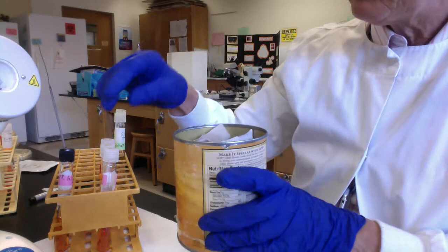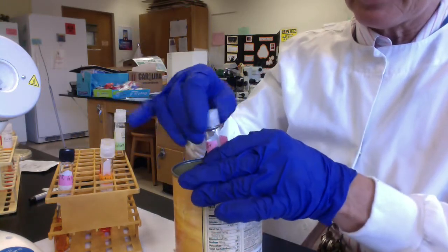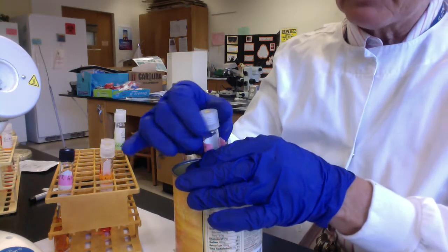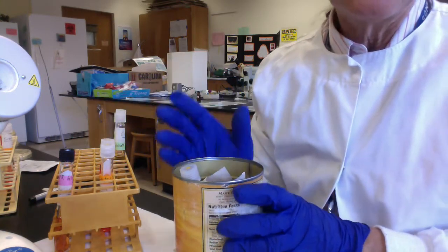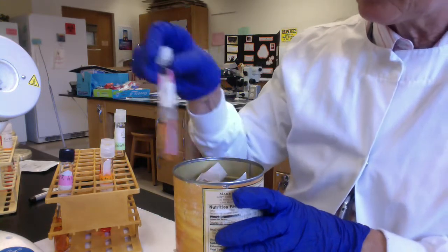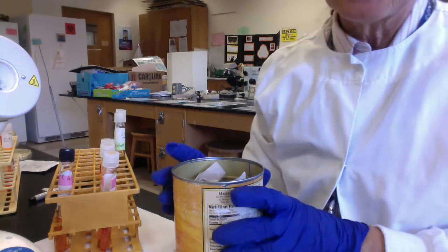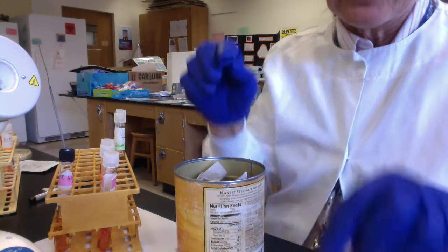And then the way we incubate, folks, we just put all of our tubes into these cans, double checking to make sure that the caps, I tighten them and then just barely loosen to vent them. We're going to put all of our tubes in here, and then we're going to incubate and read the results in 48 hours. So we'll come in this weekend to read the results on our PR sugar fermentation tubes and our thioglycollate tubes. Okay.